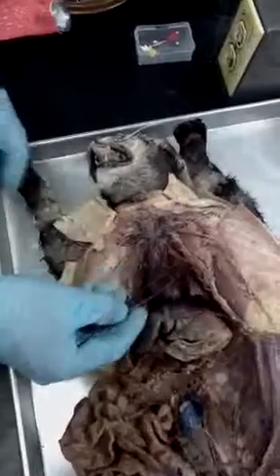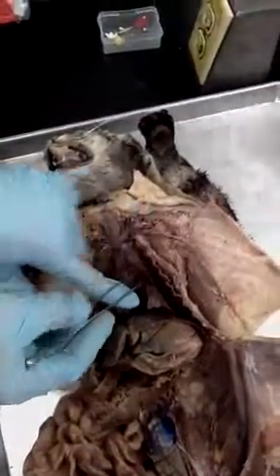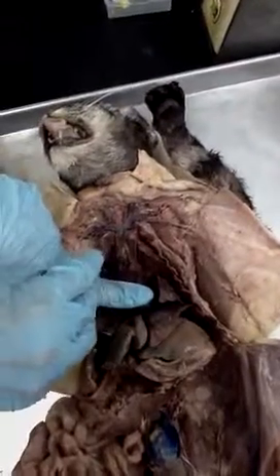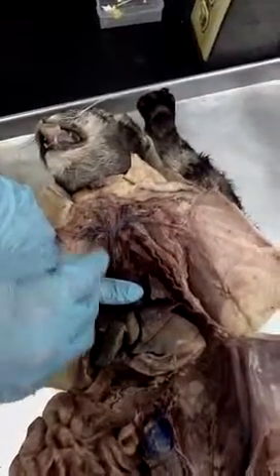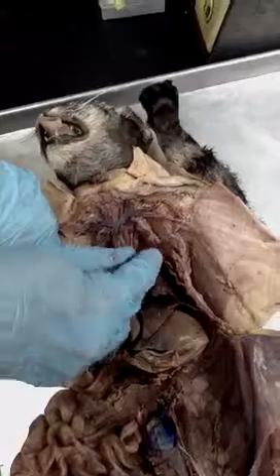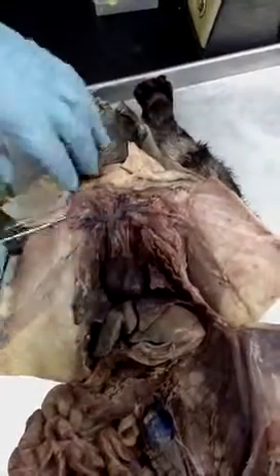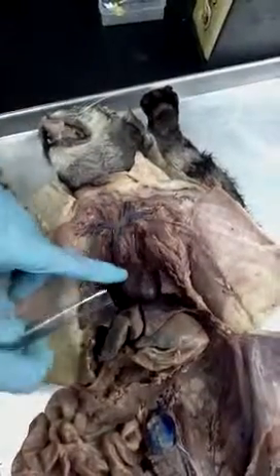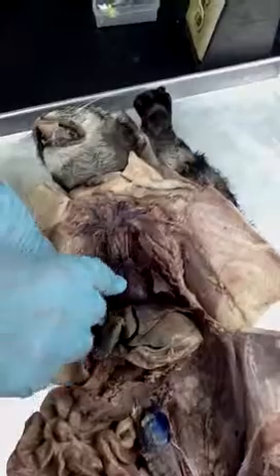So I'll just start from everything above the heart and then go below. From the heart, we've got the aorta and the superior vena cava coming out the top of the heart. The vena cava blood is actually draining down from all this going to the heart, but I'm just going to come up, so it's easier to learn what branches into what.